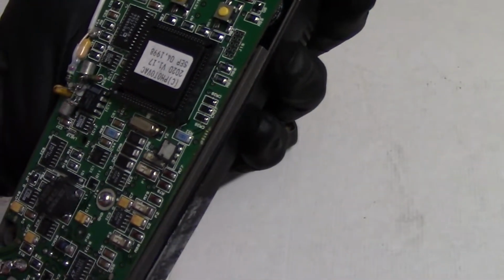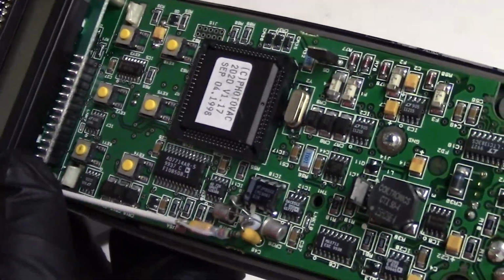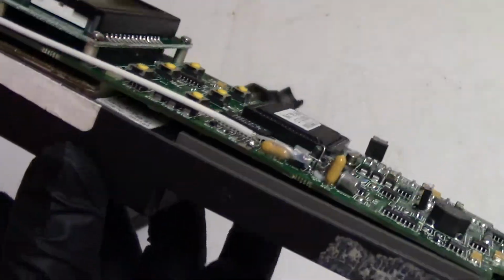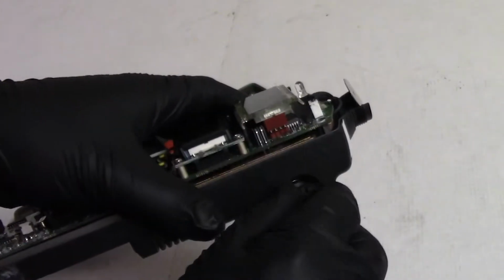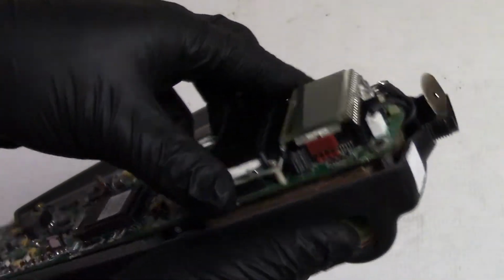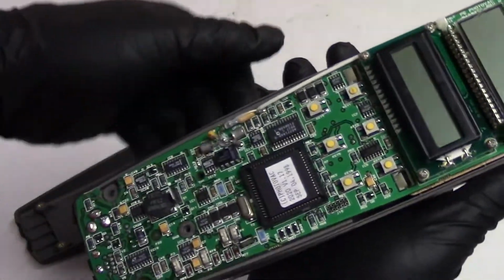Over here, what do we have? This is a piece of, I think, high voltage coax. And the way it's connected over here does make me think that it's high voltage, and it runs over and into the detector tube. Oh, to get that out, we have to take this out. So we're going to lift this out after I take the screw out here. And after we look at everything, I'll put it back together, and then we'll fire it up and see what happens.